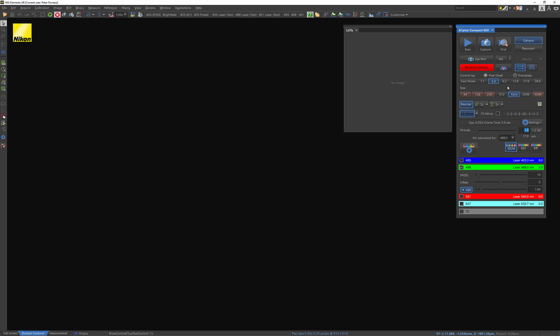I'm actually going to keep this pretty much as it is right now. 2.4 microseconds is fine with me. As I said, 1024 by 1024 resolution is also great. I'm not going to do any averaging because it typically just slows down my experiment. And all the other settings I'm just going to keep as well, including the pinhole size. But I'm going to use my lookup tables, LUTs, to adjust these settings and figure out if I need to increase or decrease either of these values.